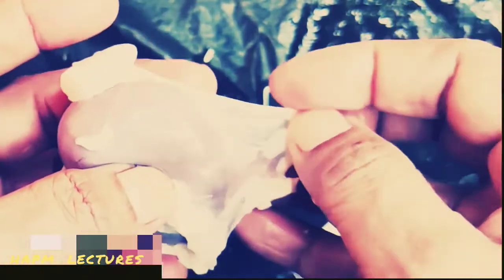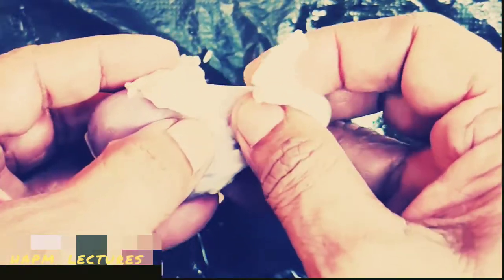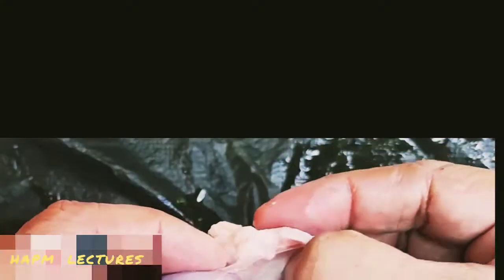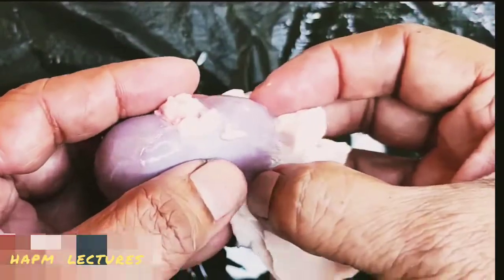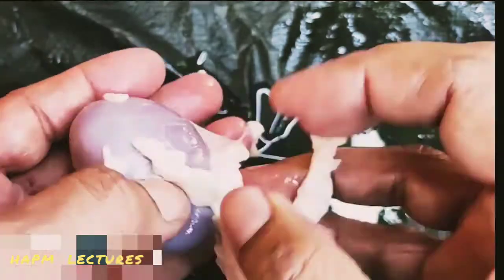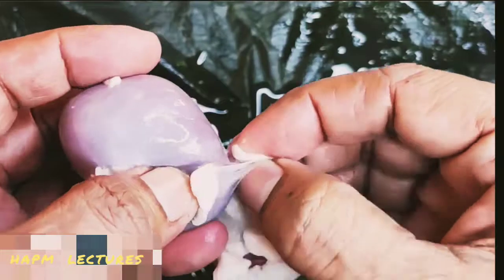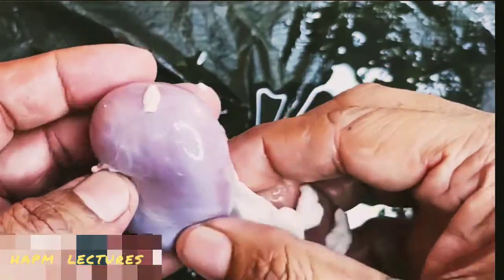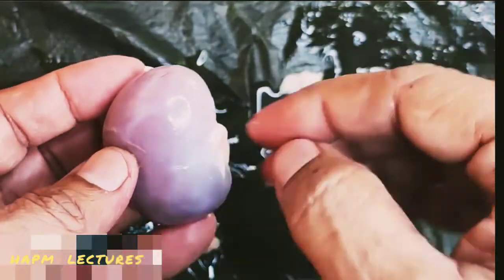Here there are three layers around the kidney. The outermost is the renal fascia, which is made up of a thin layer of fibrous connective tissue. The middle layer is the adipose capsule, a mass of fatty tissue which protects the kidney from shock, so it absorbs the shock. Inner to that, we observe the renal capsule, a smooth, transparent, fibrous membrane.